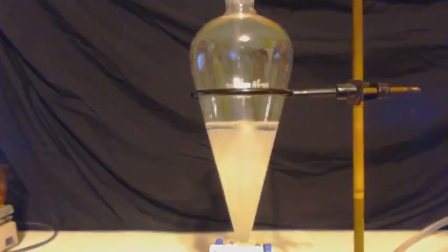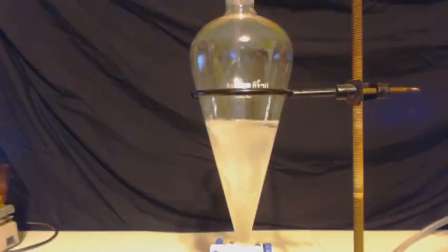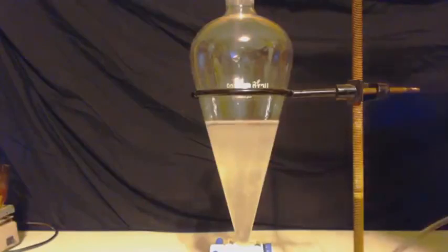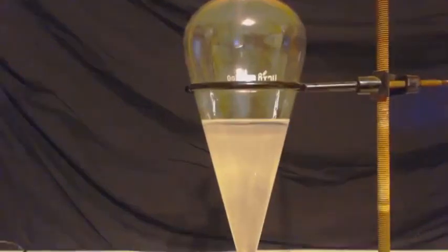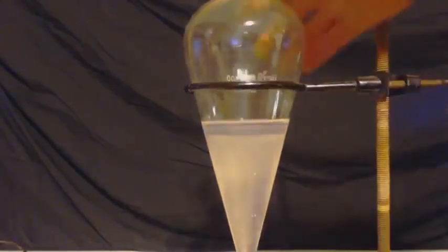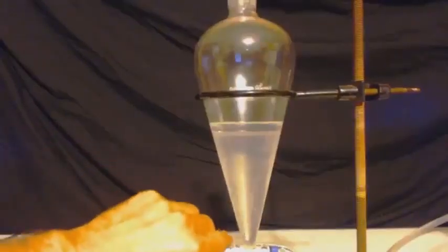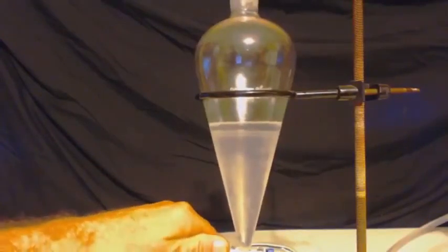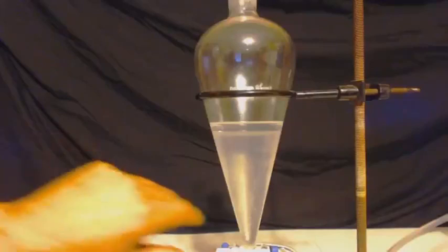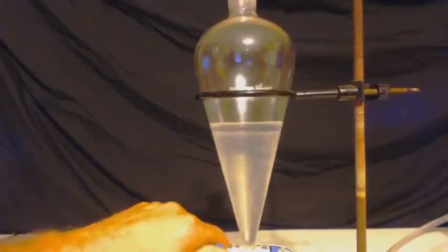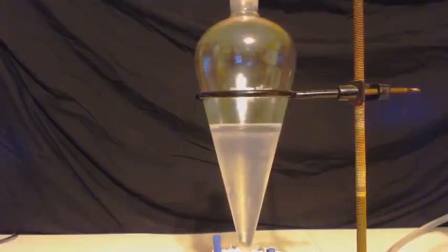And already, even without shaking it, I can see there's more than 5 milliliters of toluene there, so it looks good so far. Shake it up, and I'll let it sit there for a while. And when I come back, I drain out that bottom layer. Add some more. Drain it out. Basically doing the same thing.